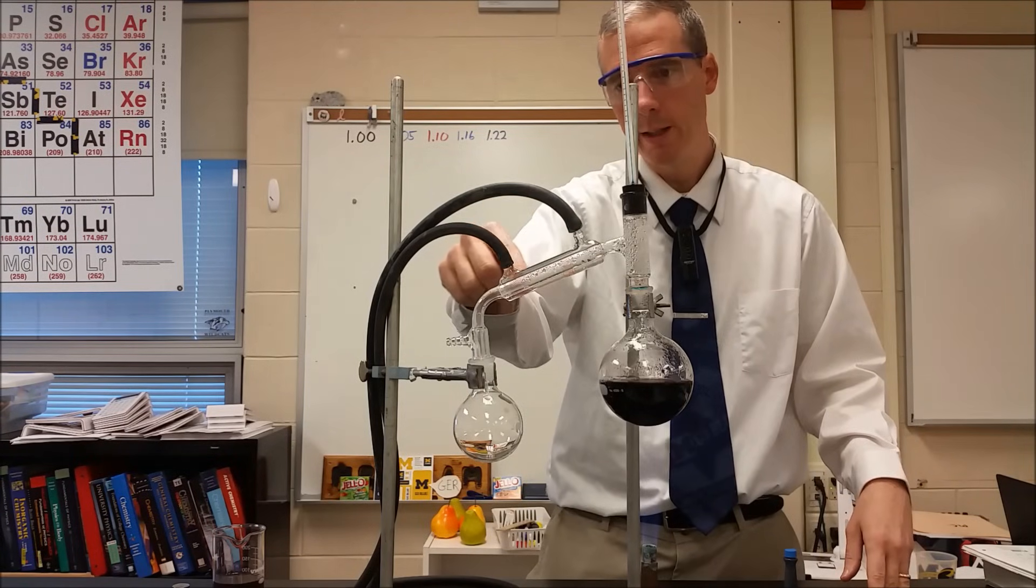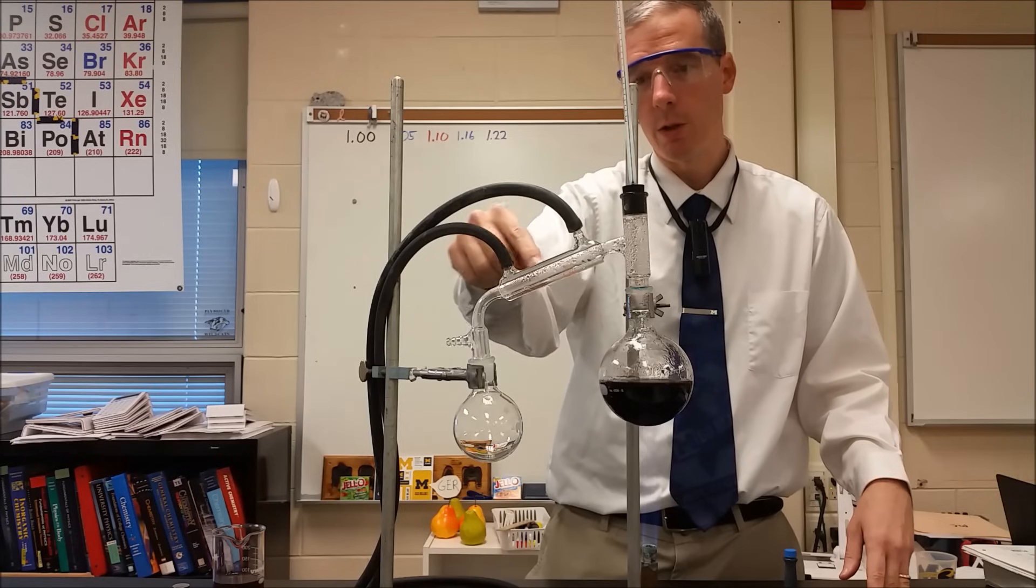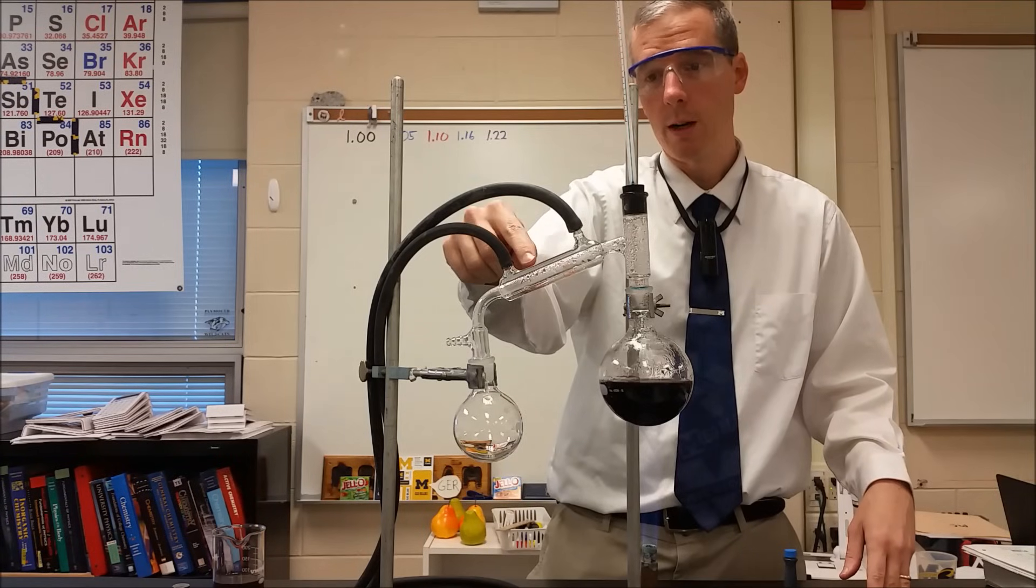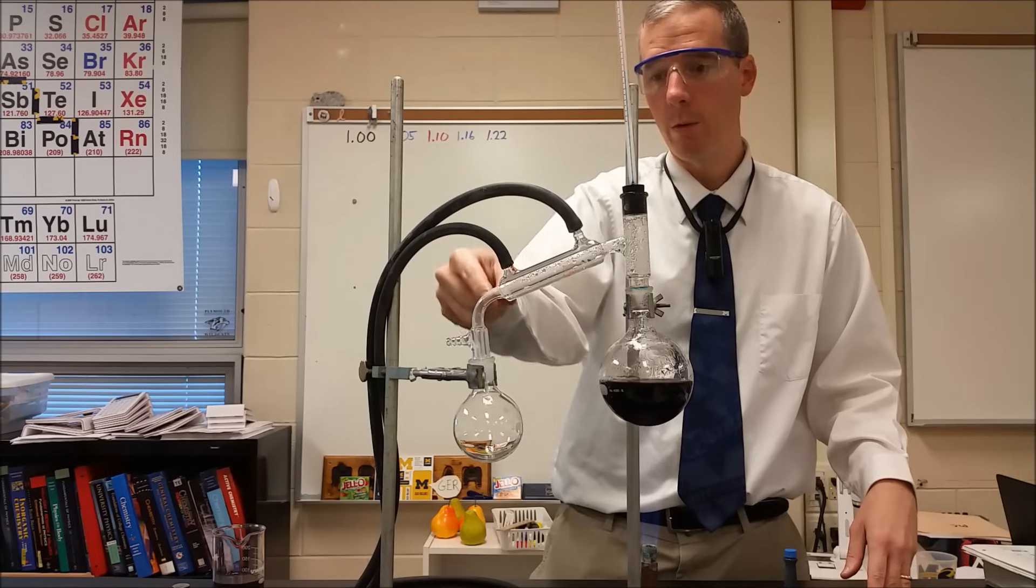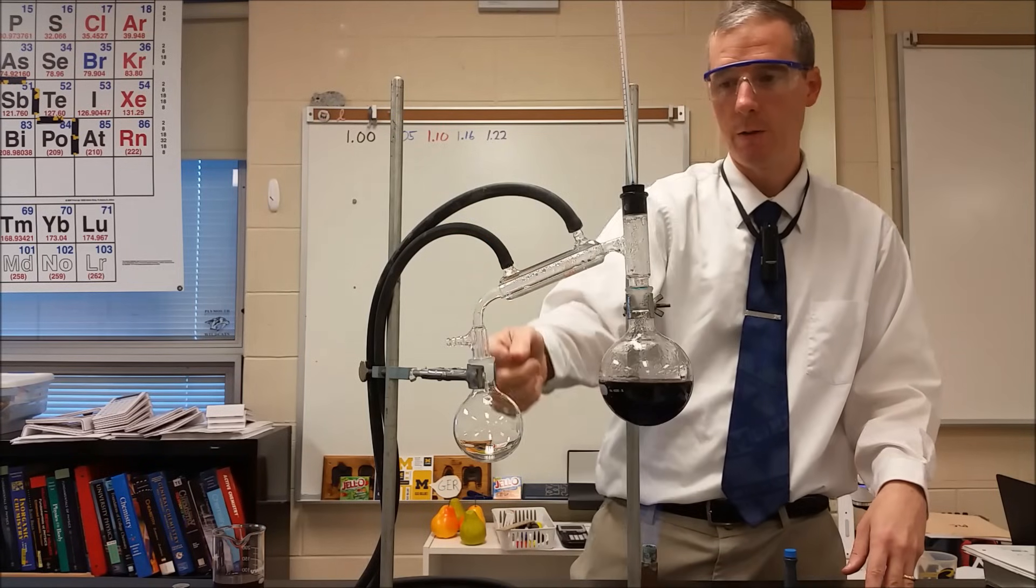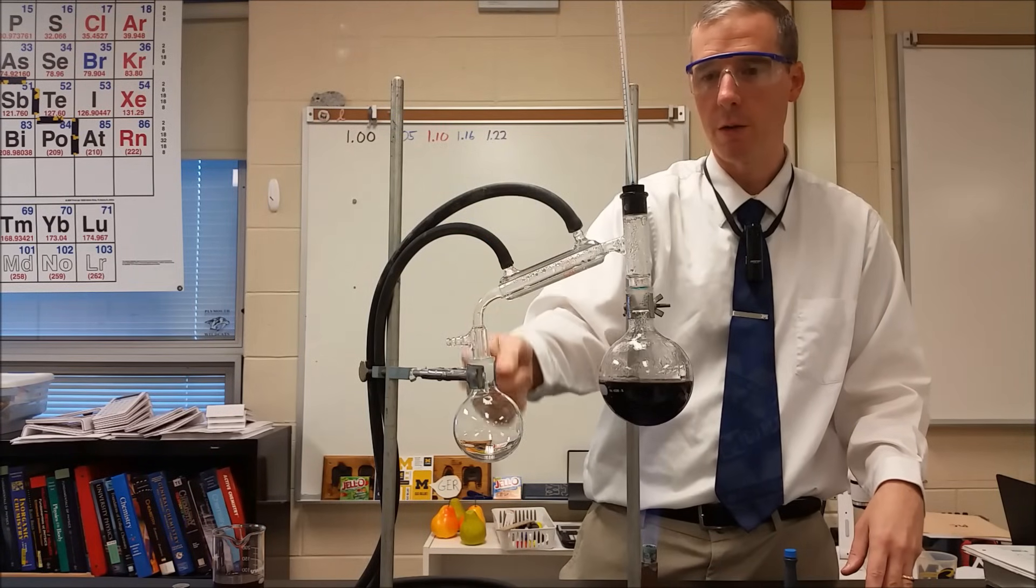we have water running along the outside of the tubing. That's going to cool down that steam and cause it to condense into liquid water over here. And then eventually we'll see that dripping start to come out through here.